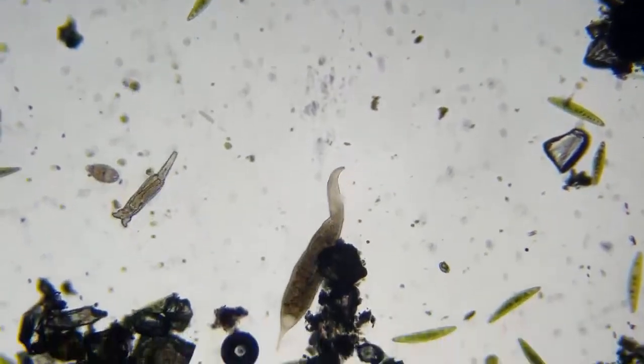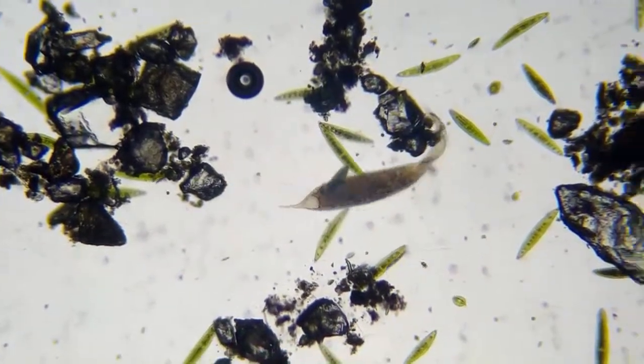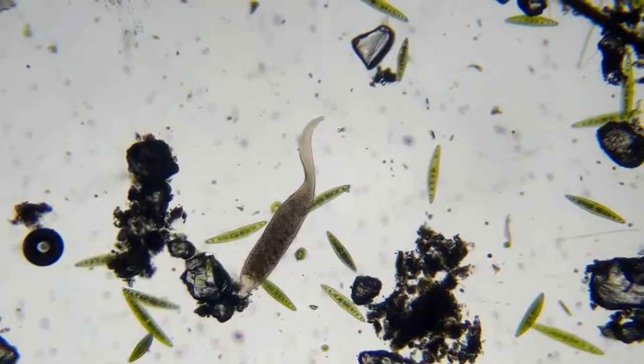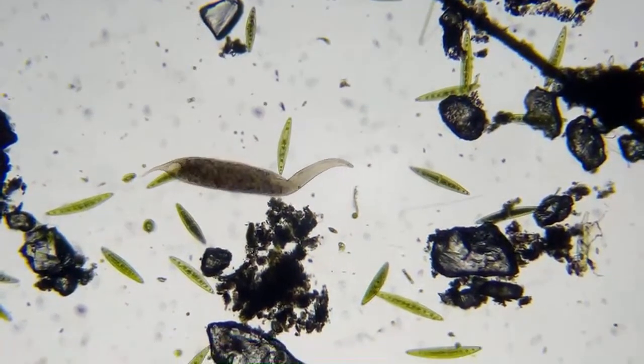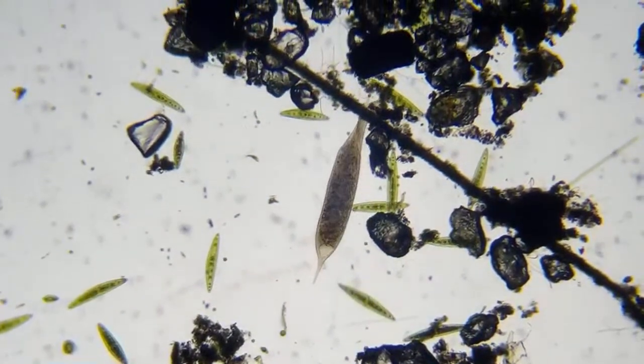He looks much better. And those rotifers, gotta watch out, because I think a Dileptus will zap them with that proboscis. Proboscis. That's what his nose is called. Somebody helped me pronounce that before. Proboscis. But if you're seeing him as clear as I'm seeing him, boy, he looks nice.